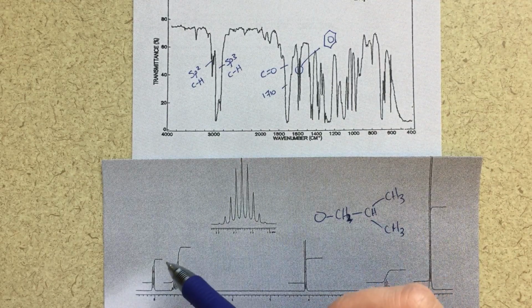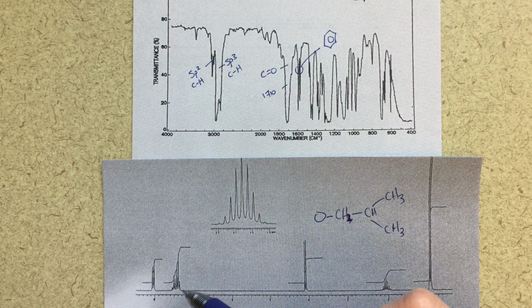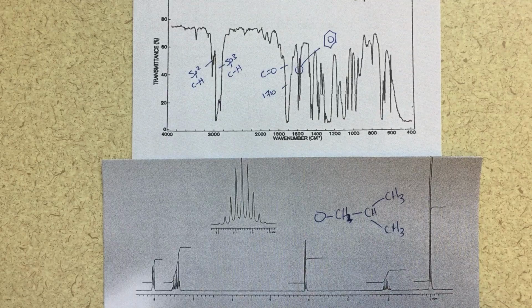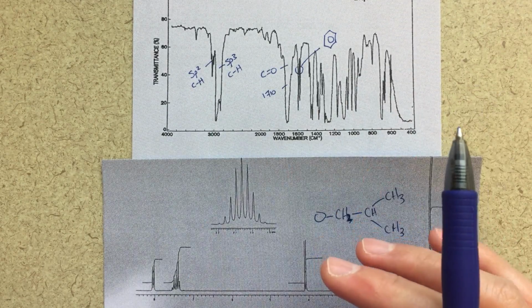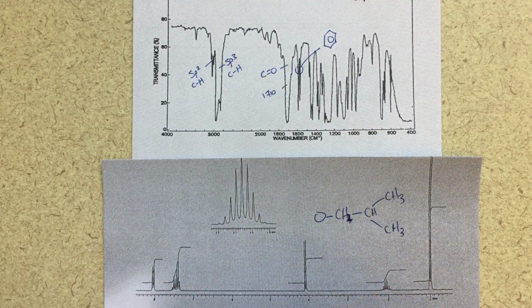Over here is an aromatic region, so here we're at 7.5 and 8. That's my aromatic region. I do have some symmetry here. The fact that we're seeing 2 distinct peaks does suggest some sort of symmetry. So not too complicated, not just a big jumble. But at this point in time, there's not really much we can assign just yet. I think we'll come back to that.